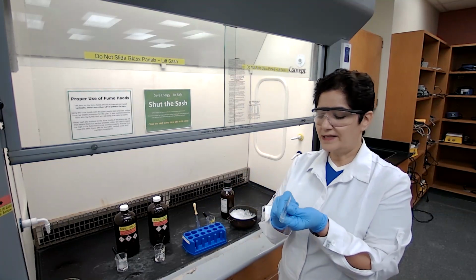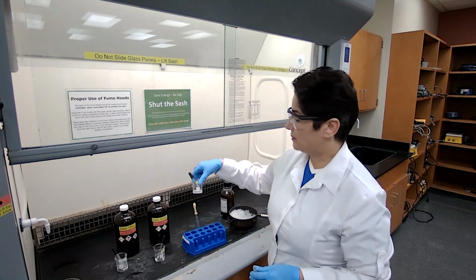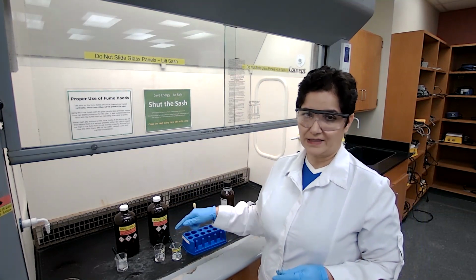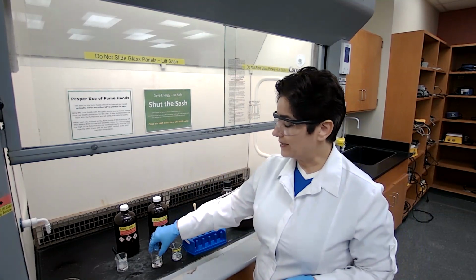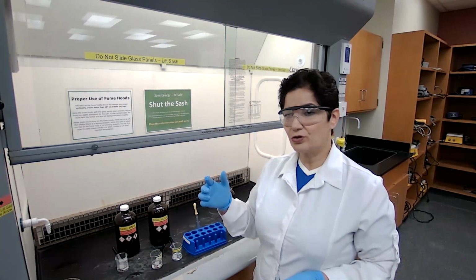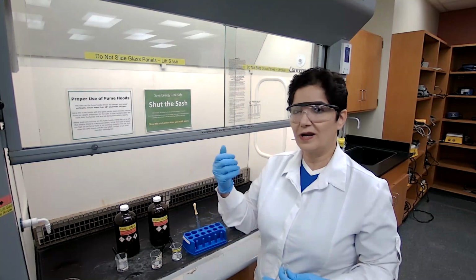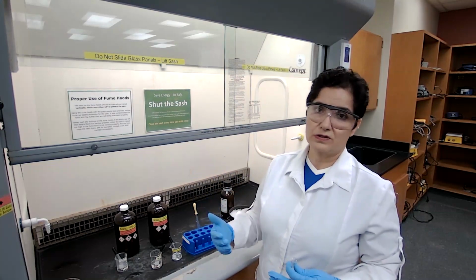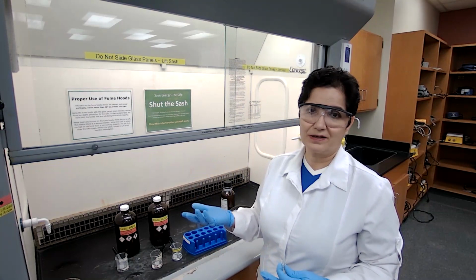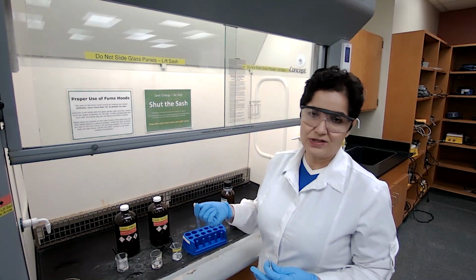In test tube A, I'm going to measure the quantity of methyl benzoate dissolved in sulfuric acid. Following the procedure, we are going to add 1 milliliter of sulfuric acid. For 1 milliliter, you have the choice of using an automatic pipetter, which we don't have enough of at this time to be used by students. The other choice would be using a 10 milliliter graduated cylinder, measuring 1 milliliter. By the time you transfer, most of it stays in the graduated cylinder.